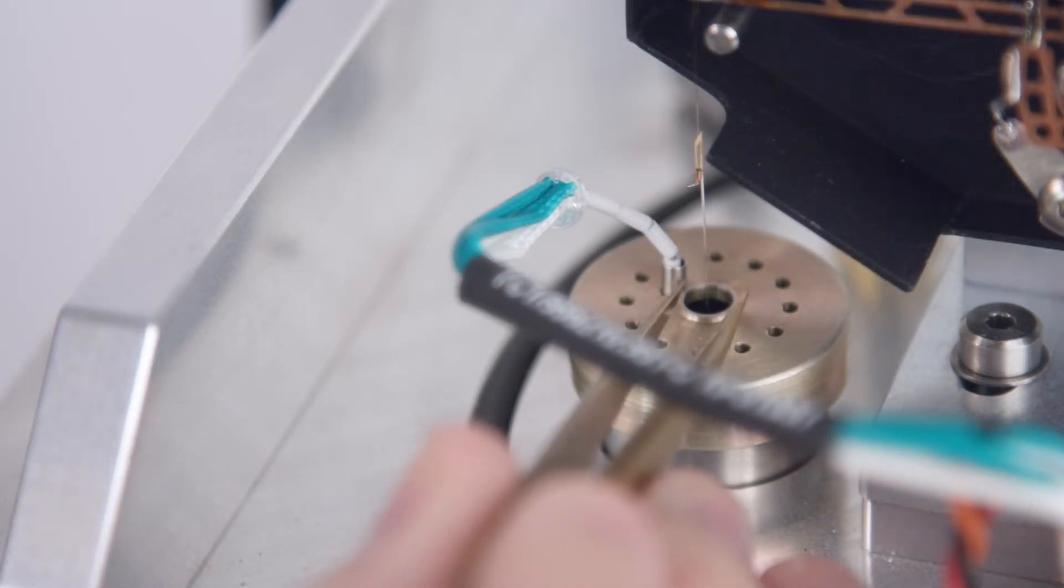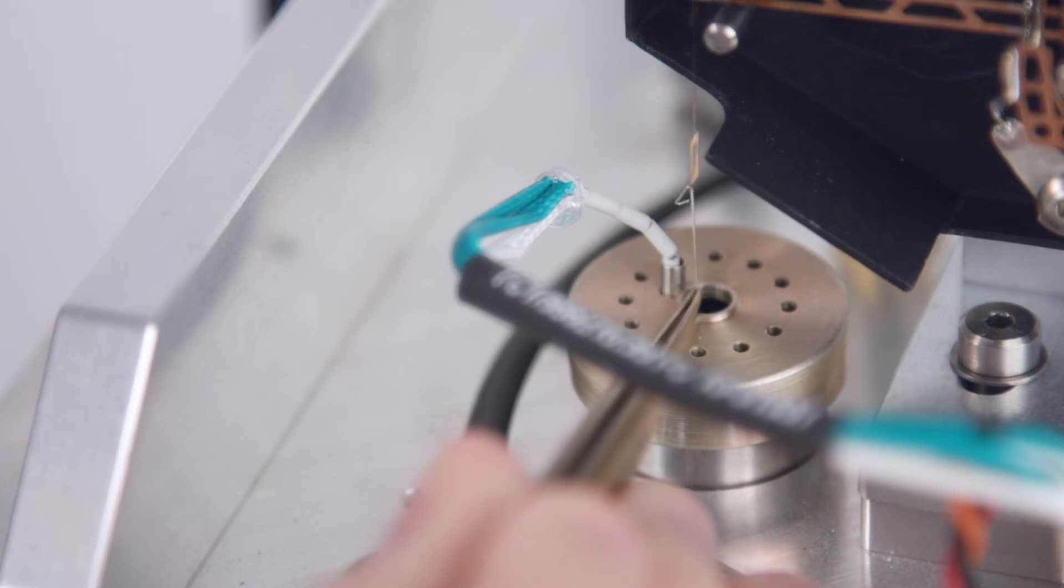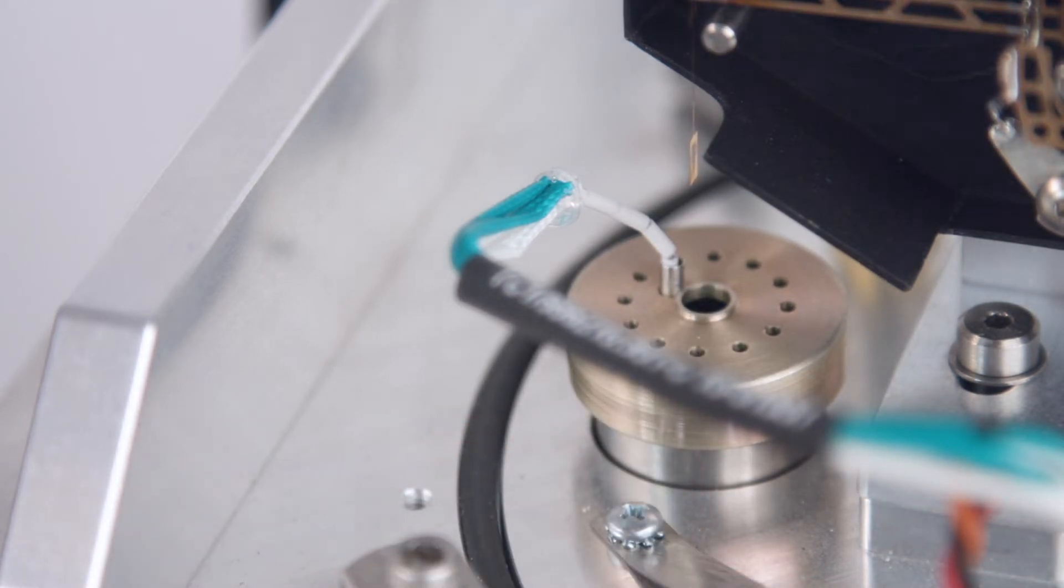Gently grasp the hang down wire and lift up and through the eyelet in the decoupler loop. Release the hang down wire, letting it fall into the tool.